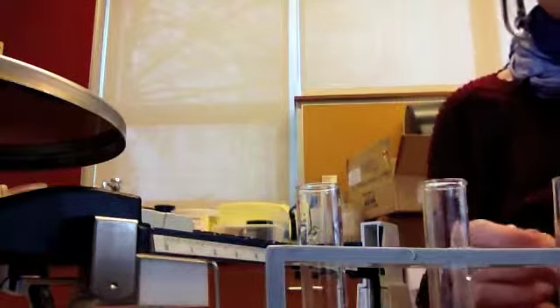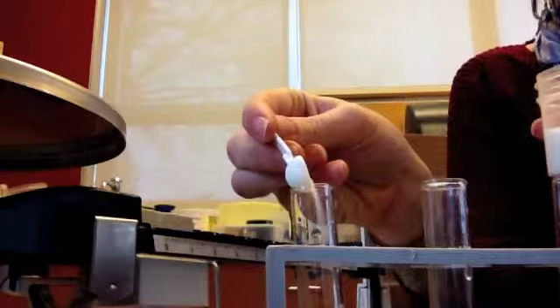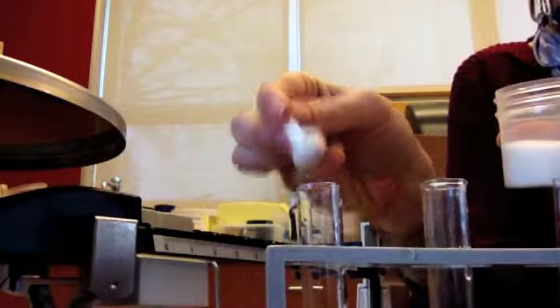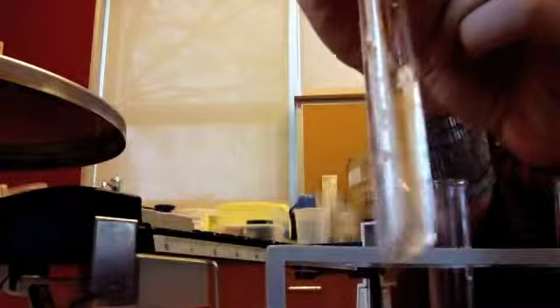So I'm going to take a little scoop of sugar and carefully pour it in. Try not to spill anything, so I know how much I'm actually adding. I'm going to just stir it. What I'm looking for is when I reach the saturation point. And we know we've reached the saturation point when it stops dissolving. So if I can stir this enough to where it will dissolve, then I can add more. But if there's still some crystals at the bottom, I know my solution is saturated.